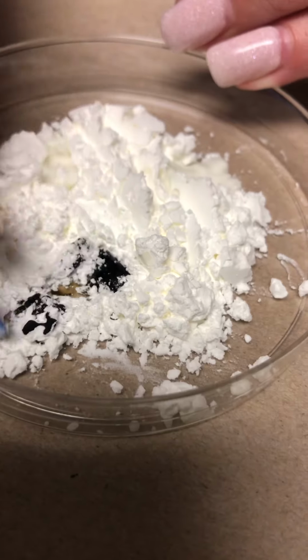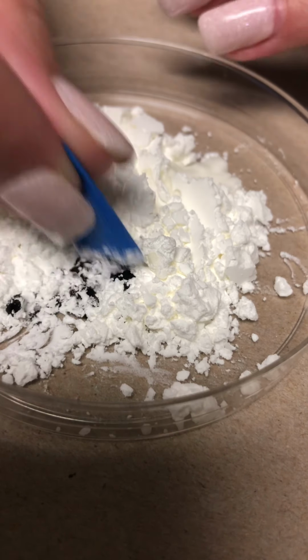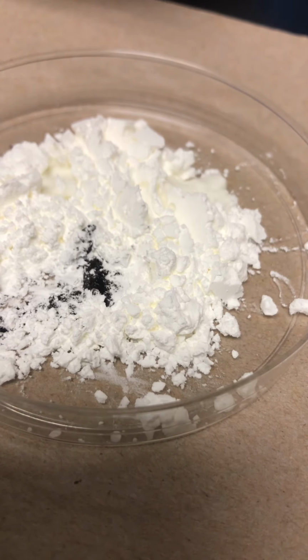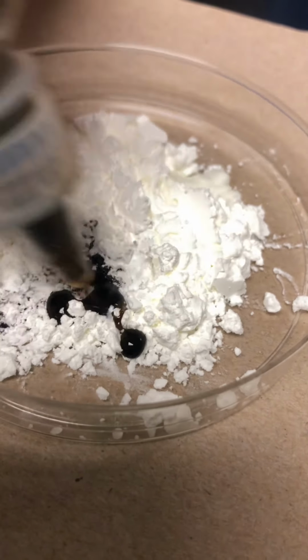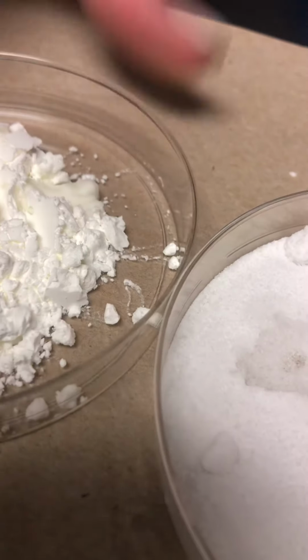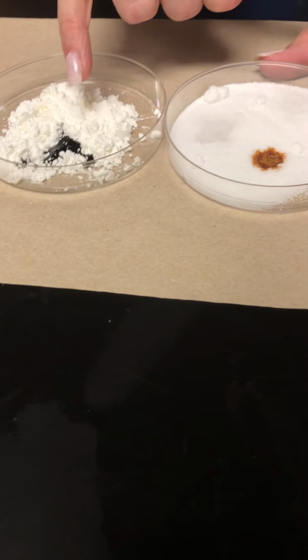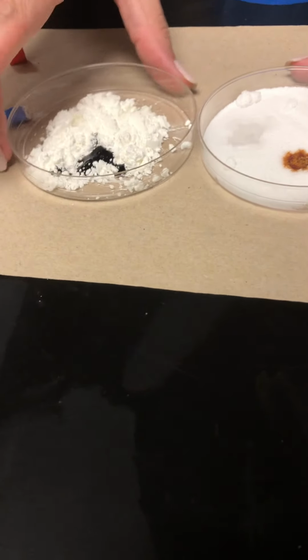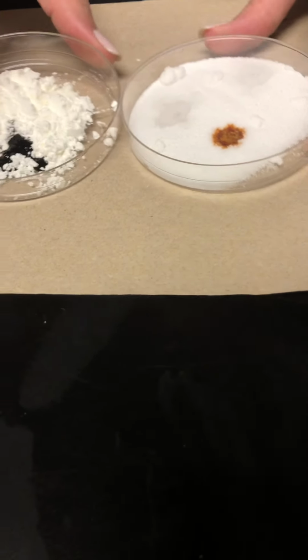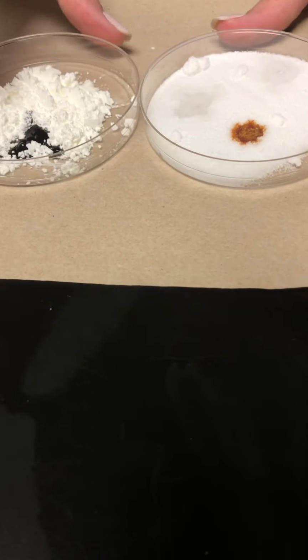Okay, it's kind of hard to tell, so I'll help you out on this one. Let me put another drop. If I bring these two over and compare, you notice the iodine changed colors. It's more of a dark blue. Okay, so that would be an actual color change. So even though it didn't bubble, you would say that was a reaction with the iodine. Okay?